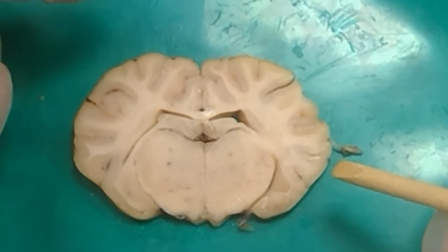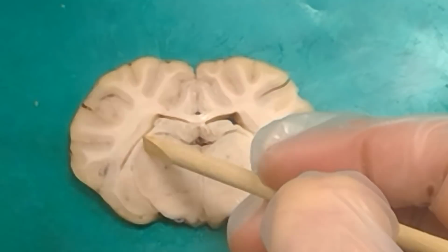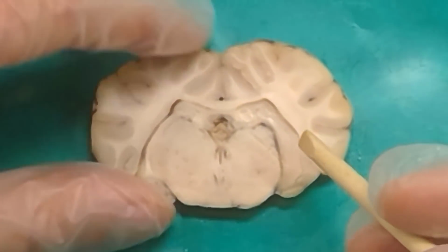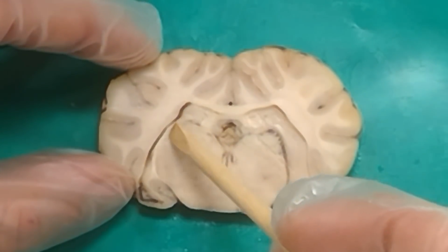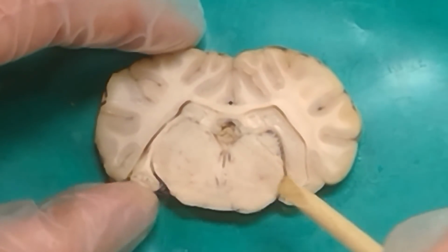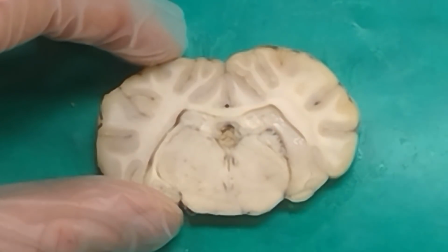It took me a while. Just days and days. But you know that thin line from top to bottom? Yeah, right. So on this cut, we're starting to see some of the LGN right here where it's darker. But this is more like LGN, where on this one you've got this big old bump on the side right there. This is also LGN, on this side of the fimbria. So that's the lateral geniculate. That's where the fibers coming from the optic tract are synapsing. They're all synapsing onto these guys right here.